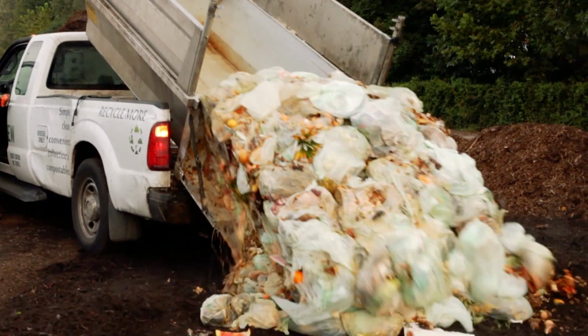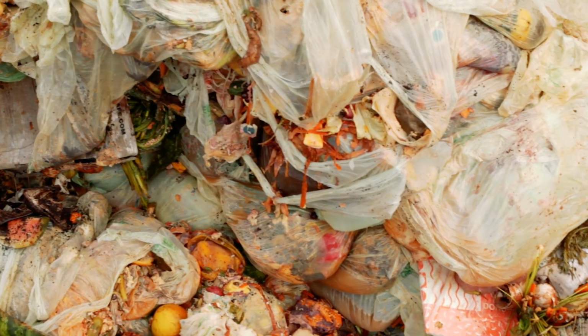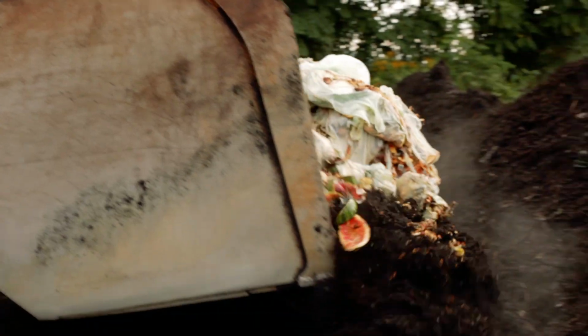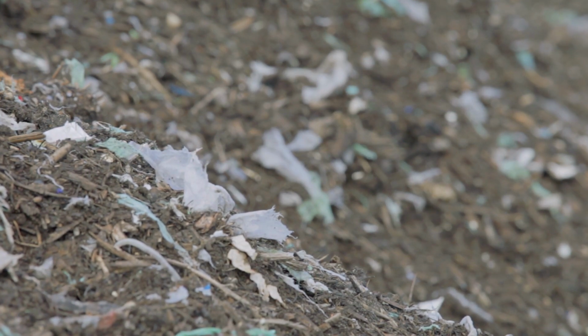A natural consequence of a larger percentage of the organic waste in the solid waste stream being captured for recycling is that some compost feedstocks contain a greater amount of physical contaminants, such as plastics and other inert materials. TMECC currently has 2 analytical methods for quantifying the percentage of inerts contained in finished compost: 03.08, the most commonly used method, and 03.06, a wet sieving method. Approximately 1 gallon of compost is typically requested by the labs to perform either of these analyses.